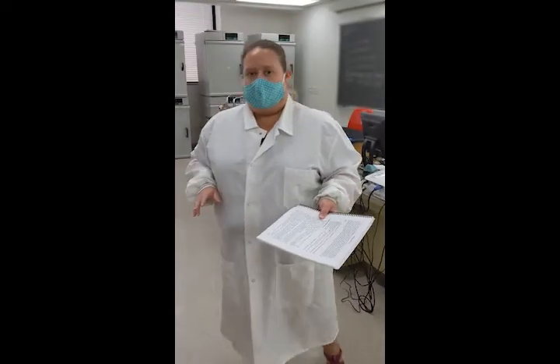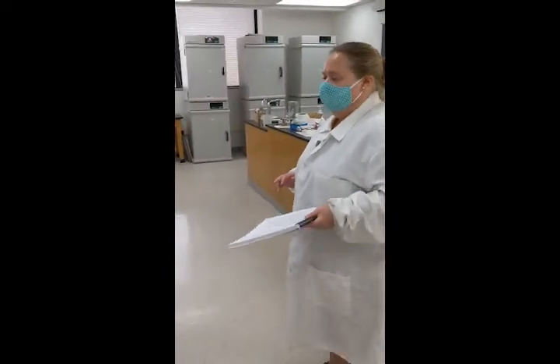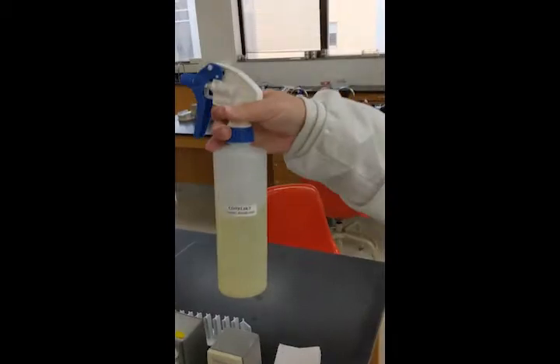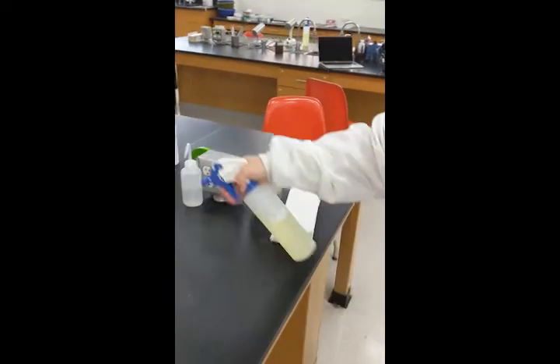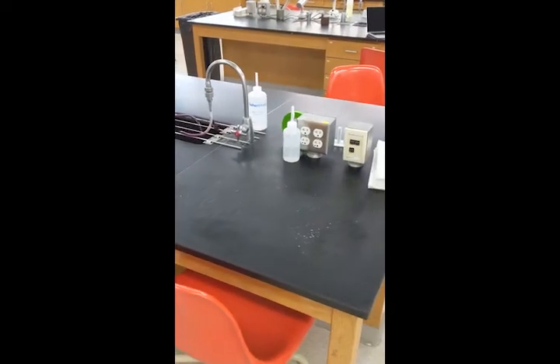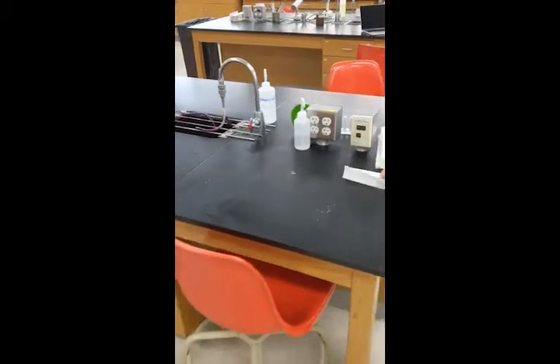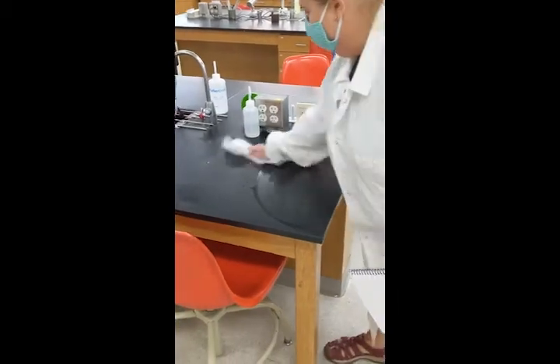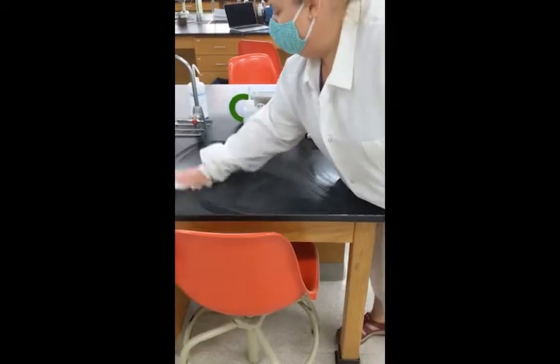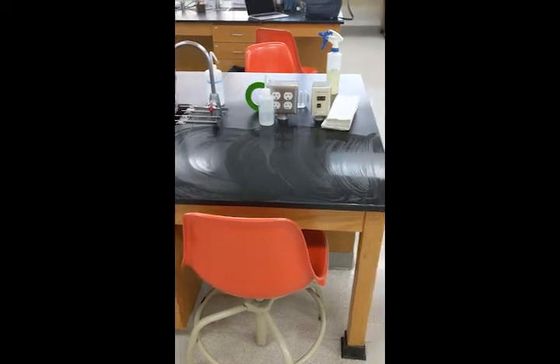One of the most important things we do in this lab is sanitize our working surfaces. What we do is take our disinfectant, which is in a bottle that looks like this. We spray it on our lab bench, let it sit for a minute, and then wipe it up with a paper towel. This will help sanitize your lab surface. We do this when we come into the lab and also when we leave. You always want to assume that the person working ahead of you did not clean their space.